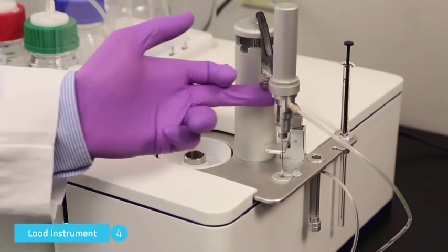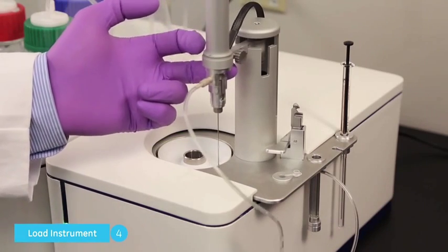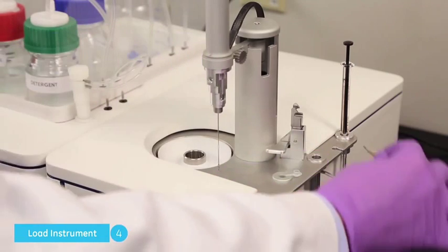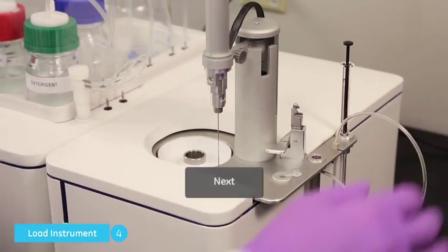After the syringe is loaded, you may move the pipette back to the rest location and detach the FPA. Return it to its storage location and click Next.